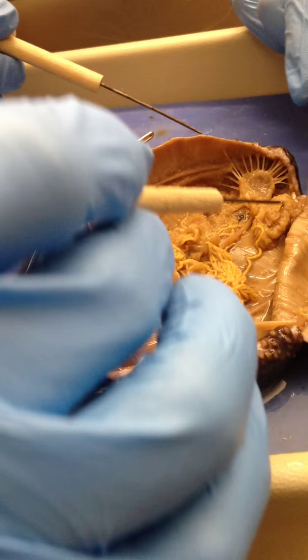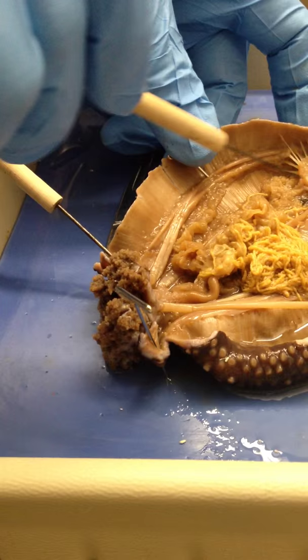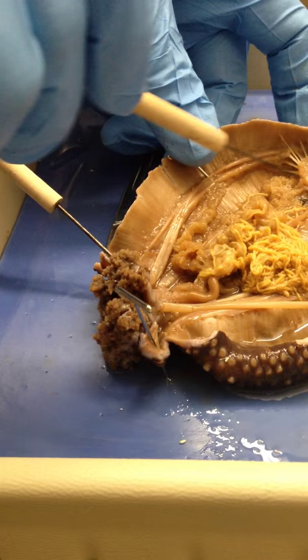There's certainly a respiratory tree. These guys have a good respiratory tree here, if you haven't seen a respiratory tree. The pharynx is this bulby thingy right here. The intestine is this stuff right here — the big fat one, as opposed to the gonads up there. And the old respiratory tree. That's it. And that completes our sea cucumber.